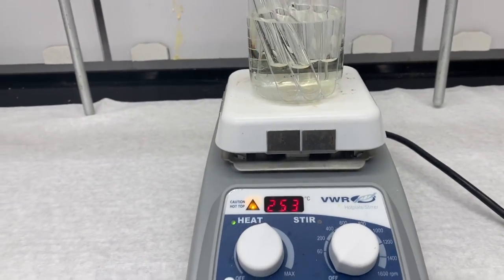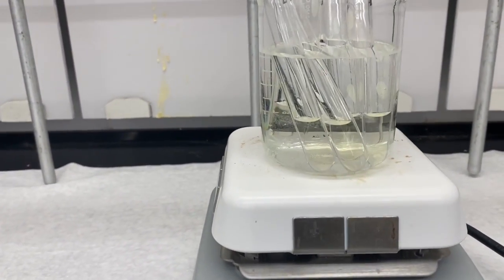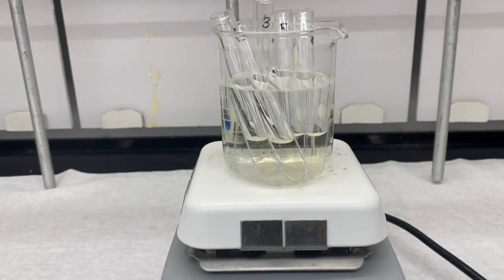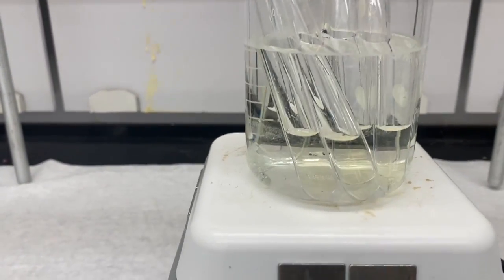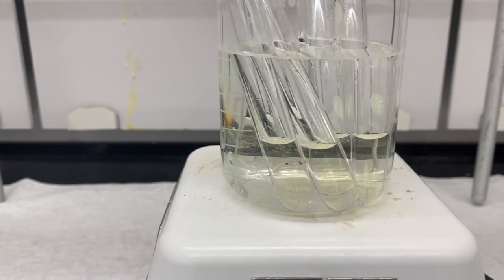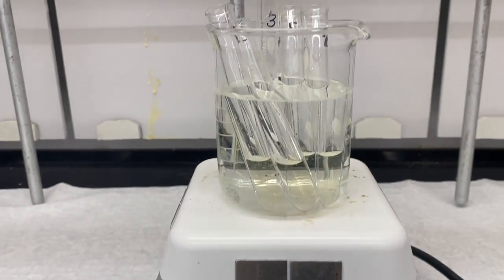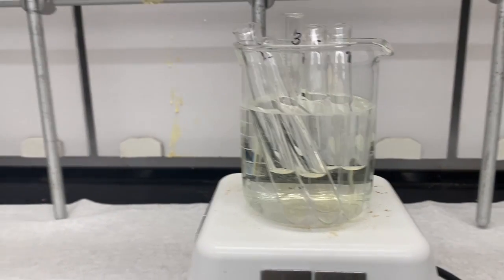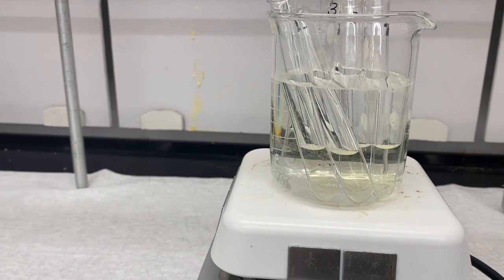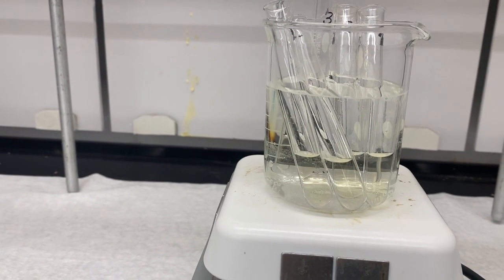So we're going to heat these test tubes to 50 degrees Celsius. We kind of overshot it at first, so we let it cool a bit. Why specifically did we choose 50? Think about the solvent that is being used to react with our reagents. So we're going to heat the rest of these test tubes in a water bath to 50 degrees Celsius. Think about why specifically we're going to heat to 50 and not beyond that temperature, and you can think about the solvent that's being used in these reactions to encourage that SN2 type reaction.